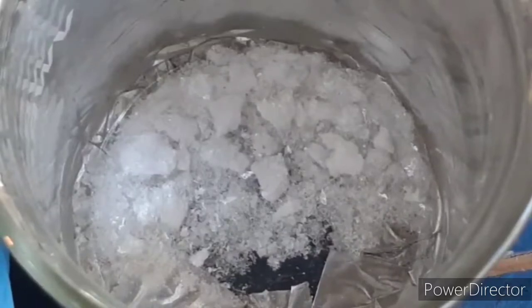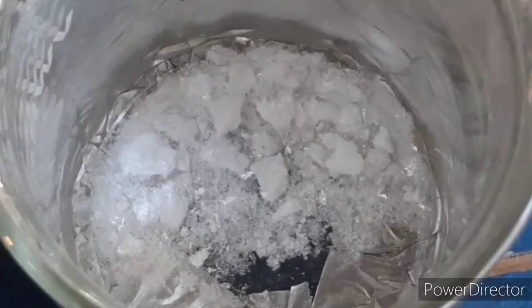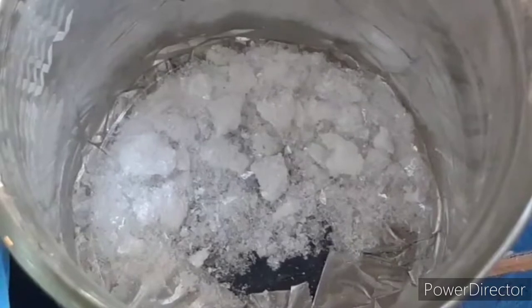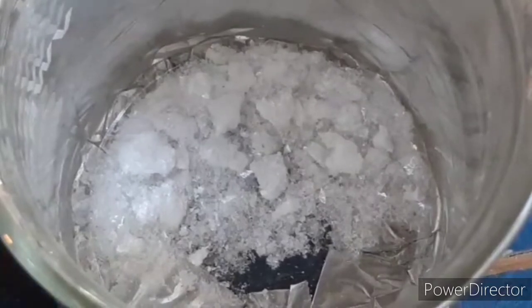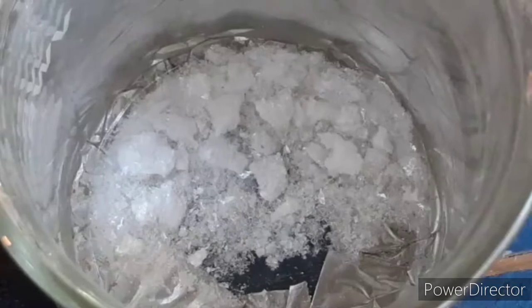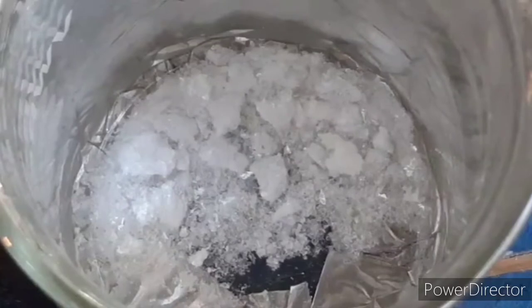The plan is to dissolve this in water, then react it with a stoichiometric amount of our cyanide solution, which will precipitate out silver cyanide. We'll decant off as much of the solution as possible, react that with the same amount of cyanide again, and that should give us our mostly potassium dicyanoargentate. We'll then evaporate it down and see if we can get some beautiful crystals. The gold analog gives nice colorless crystals, so maybe the silver one will too.